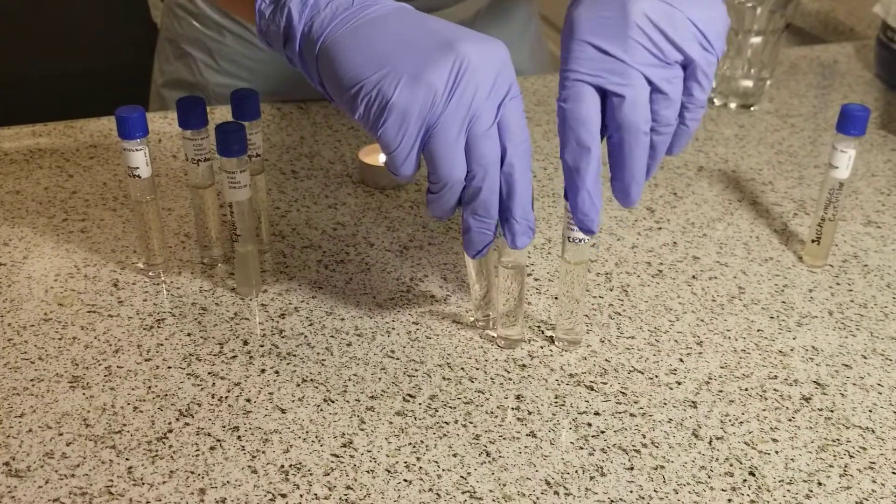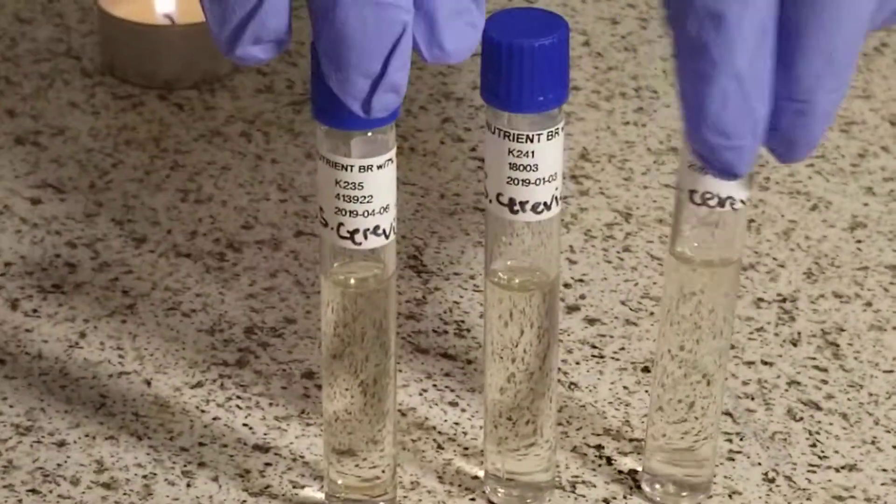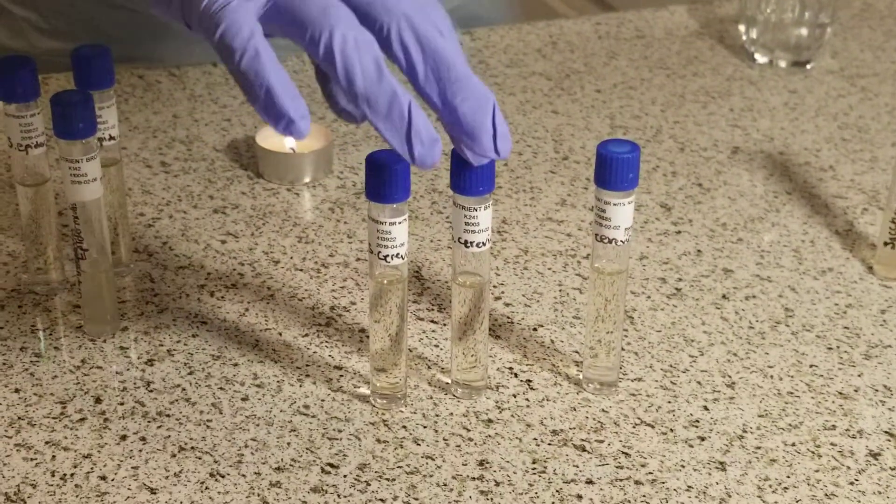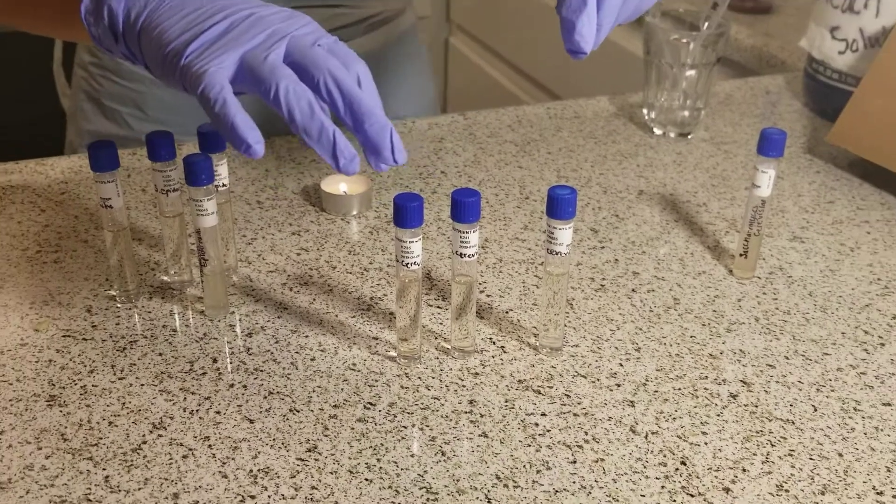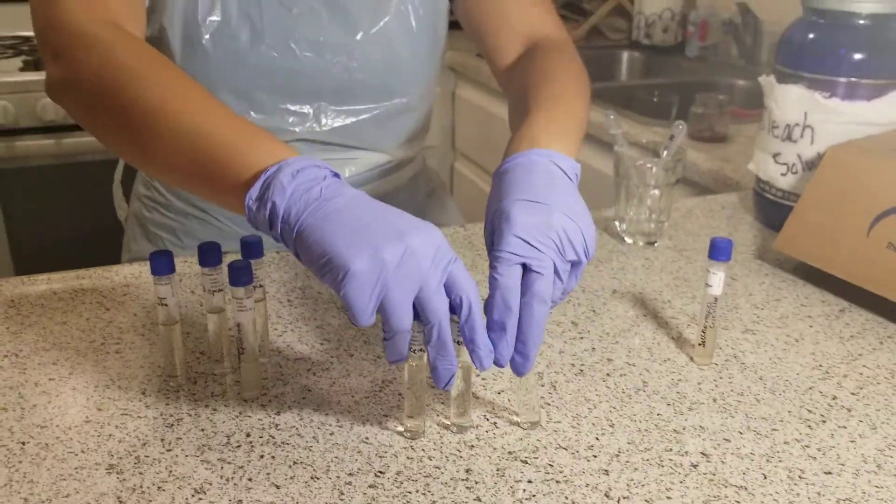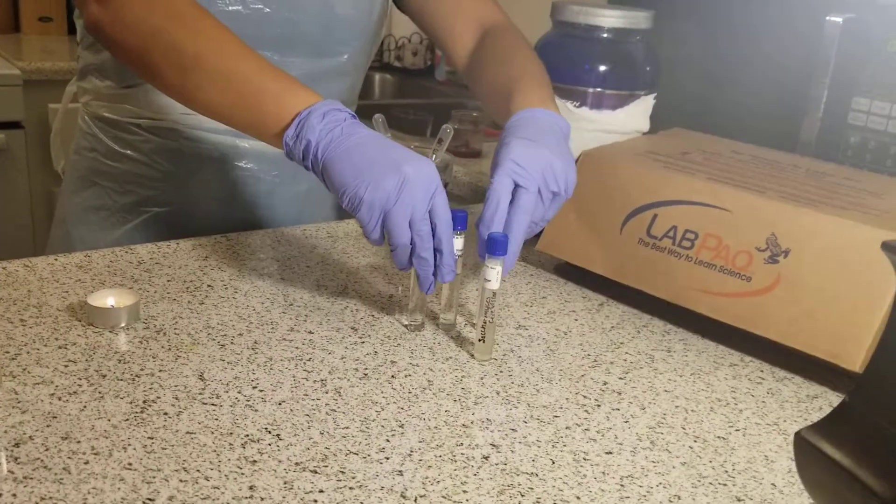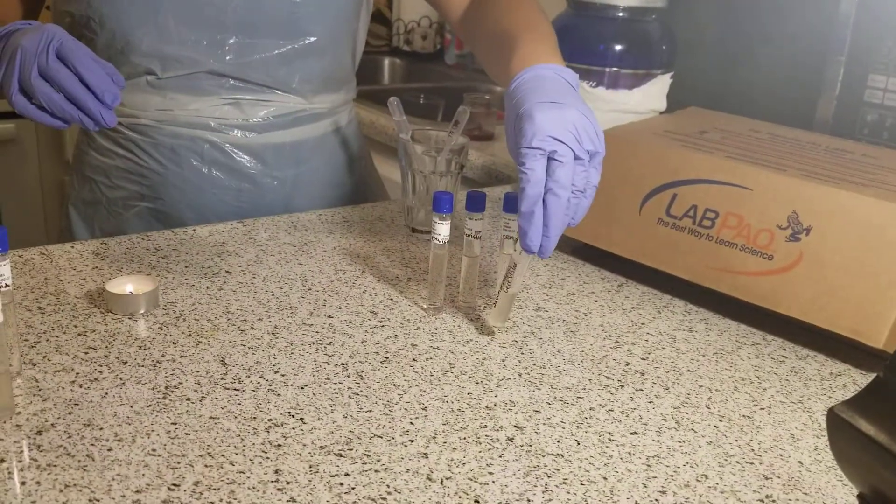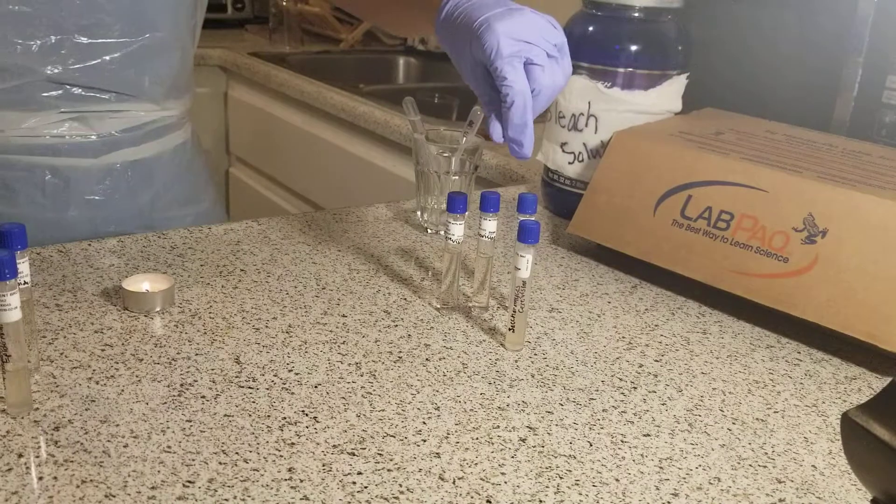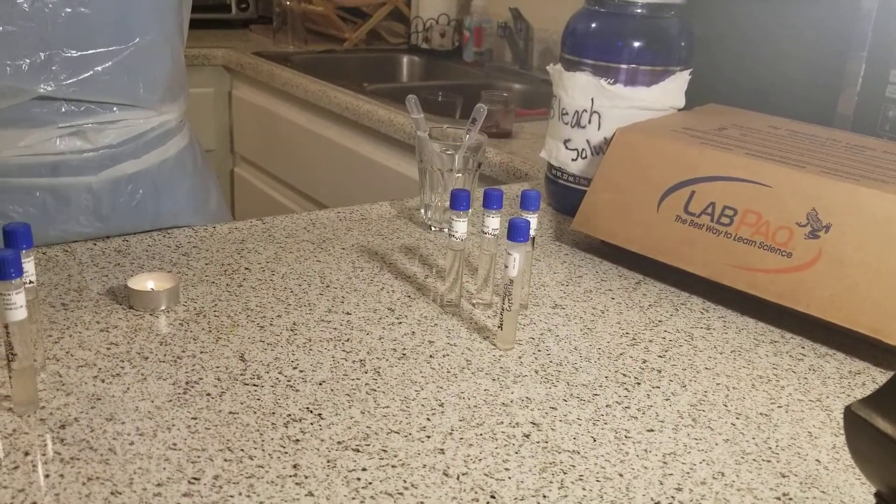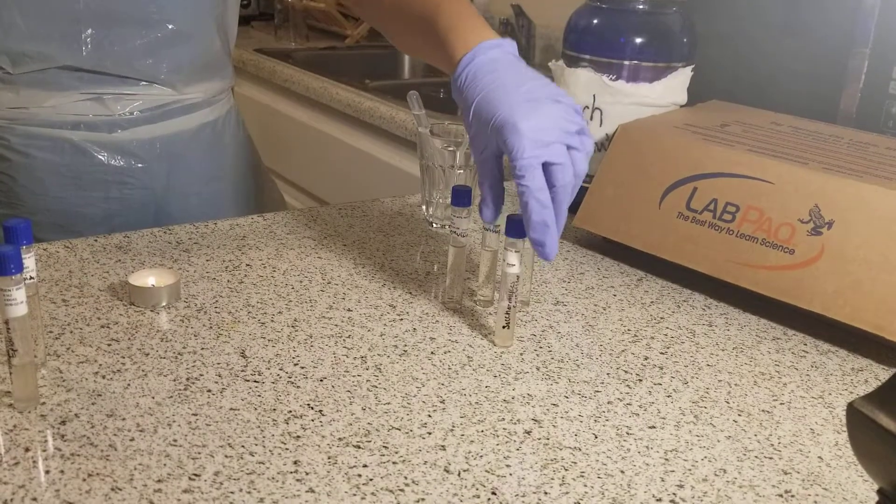You can see I have 1%, 5%, and 15% sodium chloride tubes. This set I've already inoculated with the S. cerevisiae broth and culture.